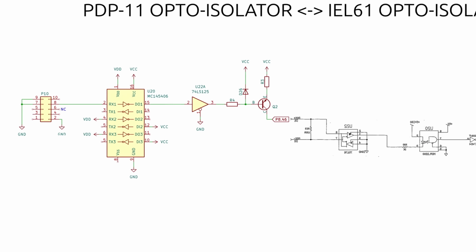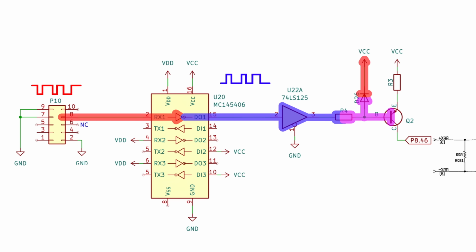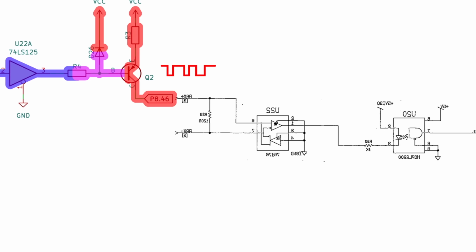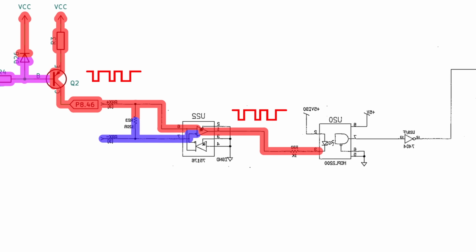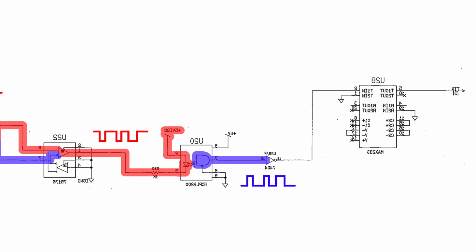So if the PDP-11 is sending serial data to the Bomem, we start off just the same. DEB41's outputting RS-232 through an MC145406 to level shift it, which inverts it, then the LS125 to buffer it, then a PNP current driver that inverts it and drives it down the 50-pin cable. Here's where things get weird. The 75176 bus transceiver takes the differential input and turns it into a TTL level output that gets fed into an HCPL2200 opto-isolator. But because of the way that they're feeding this opto-isolator, you end up with an inverted signal coming out the other side of it.